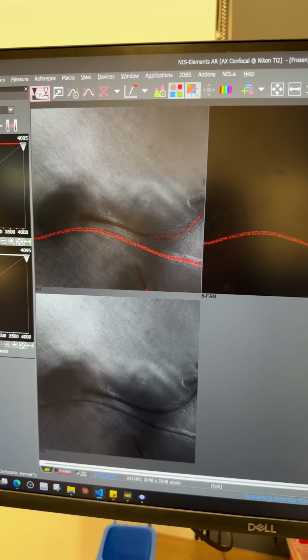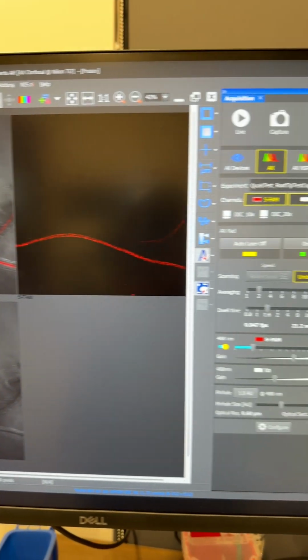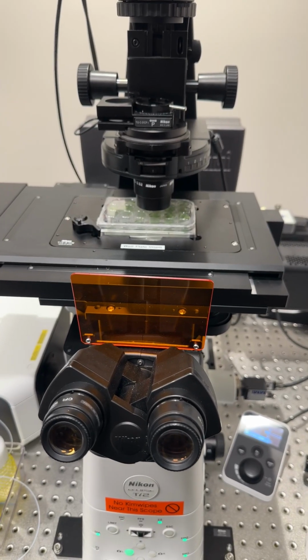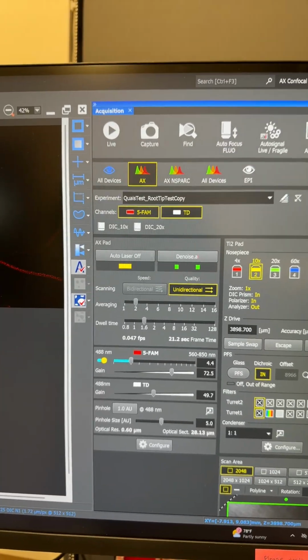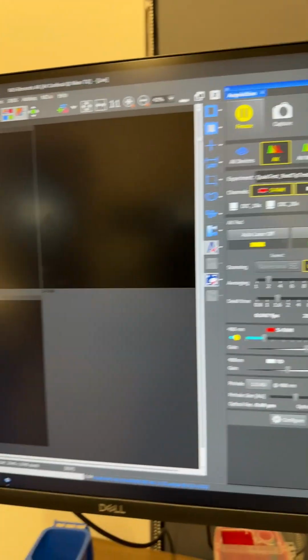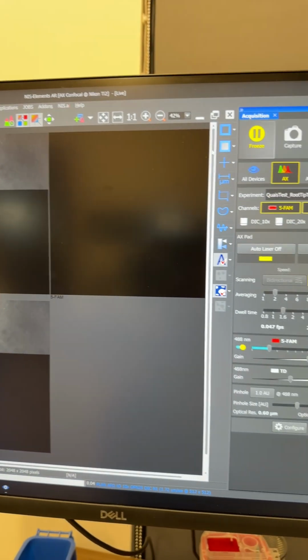So here's the new feature I've been working on, which is getting the real image capture working on our confocal microscope. I'm using the actual Arabidopsis sample to capture the real images. The existing NIS captured the images from here. If you see, this is how it captures. But now what I have done is to fully automate this trigger.